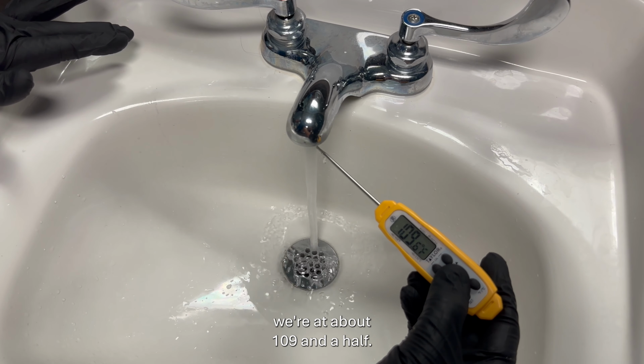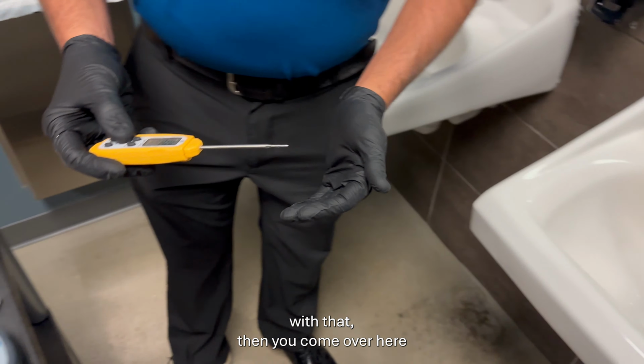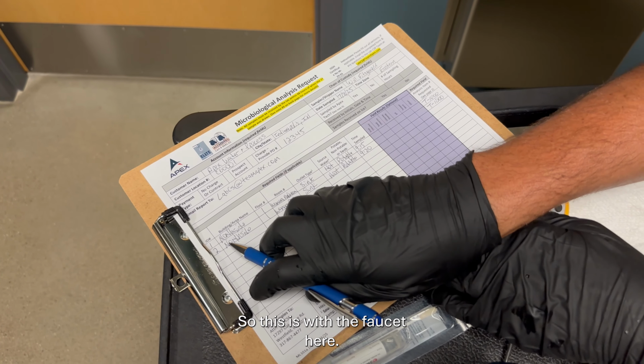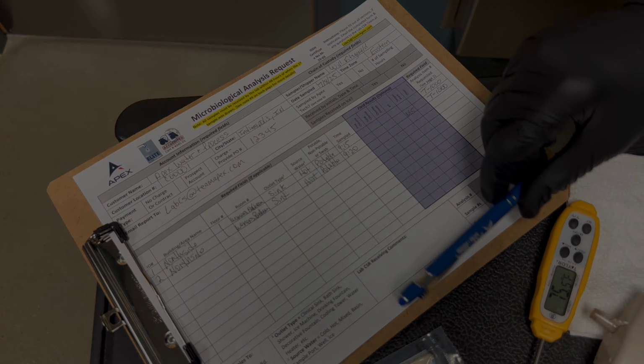Let's just say we're at about 109.5. So once we're done with that, you come over here and you fill that information in. So this is with the faucet here. You want to put the temperature, which is right here, 109.5 that we just measured, and put it in that slot.